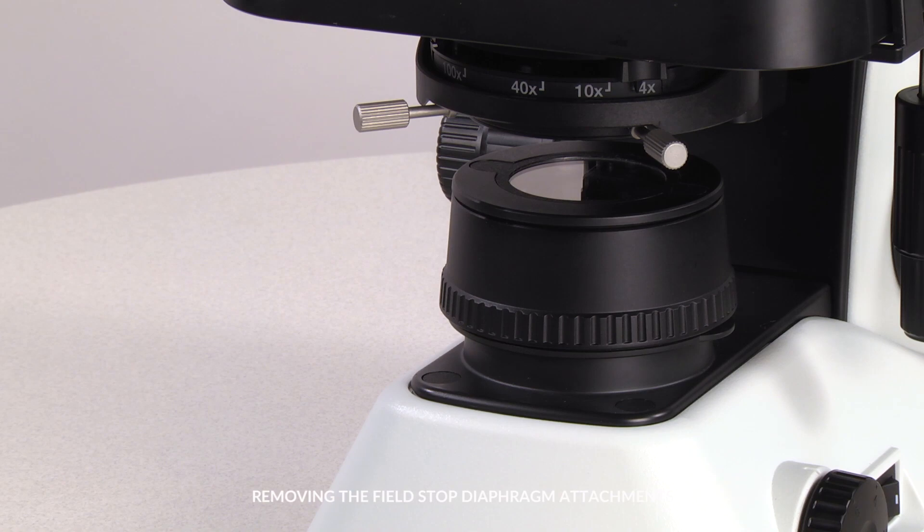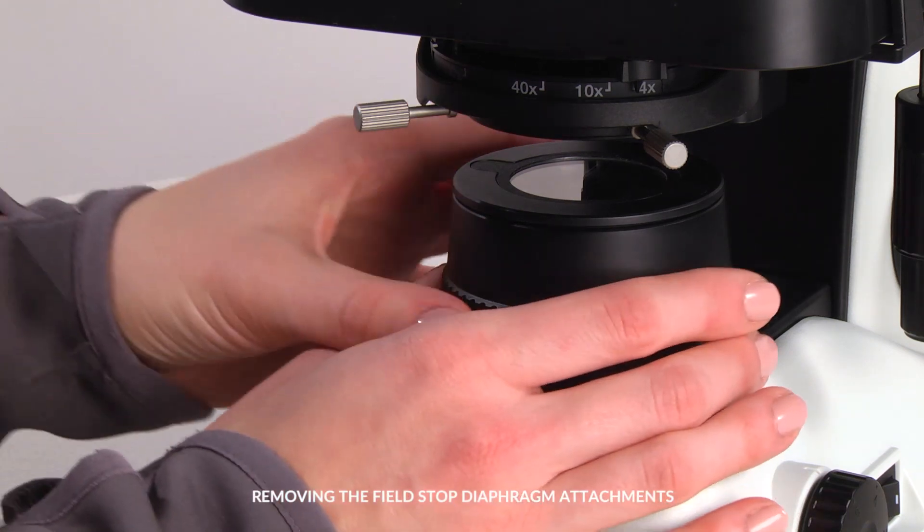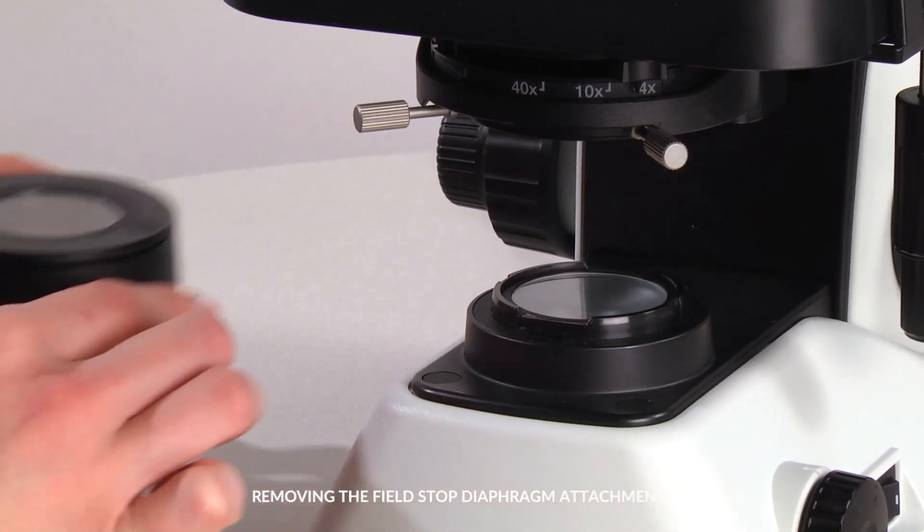To remove the field diaphragm, gently lift the unit up to remove it from the LED illumination window.